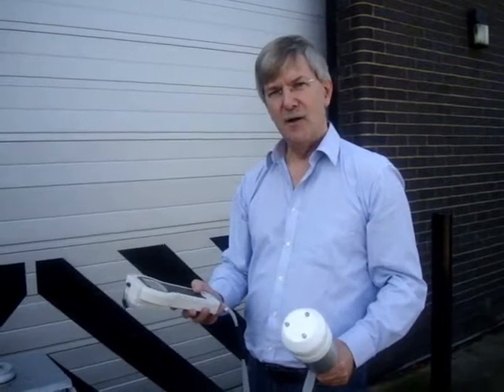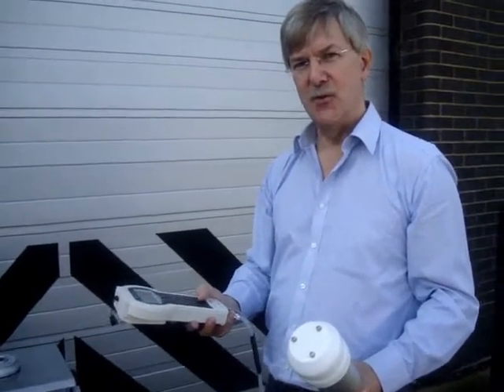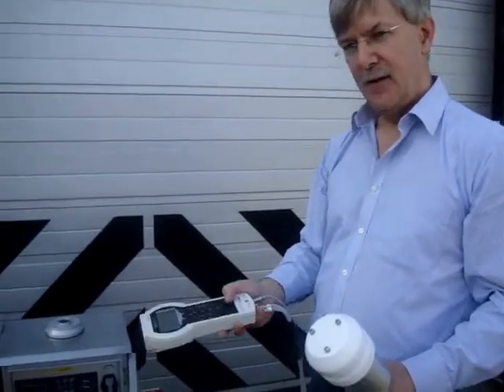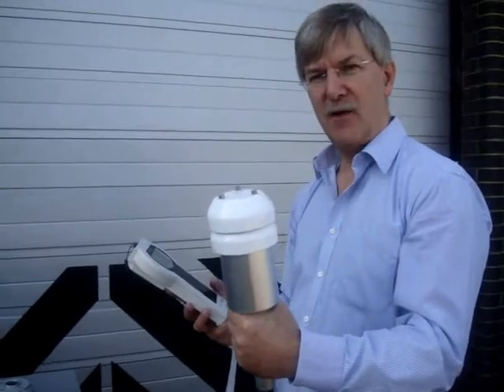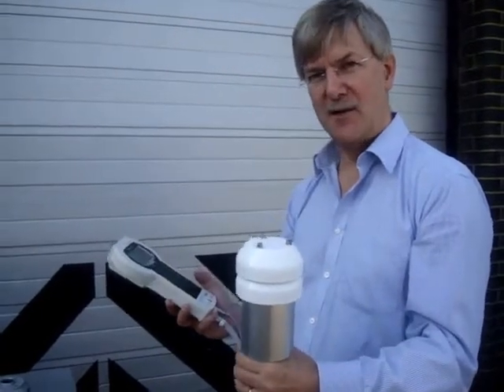This is the Tecora FlowCal Air, a device used to verify the flow rate drawn by an air sampler. The handheld device is used in conjunction with a flow cell specific for the flow range drawn by the sampler under test.